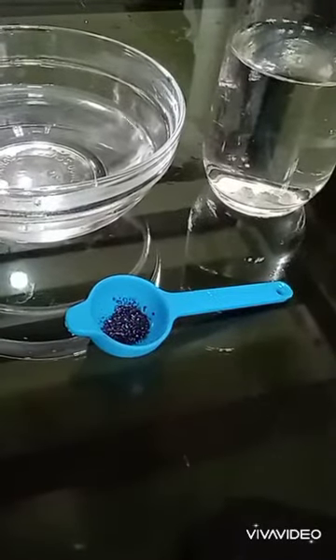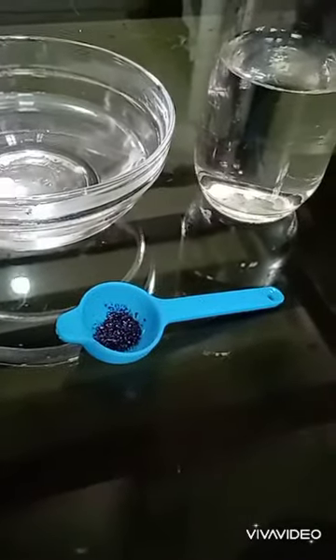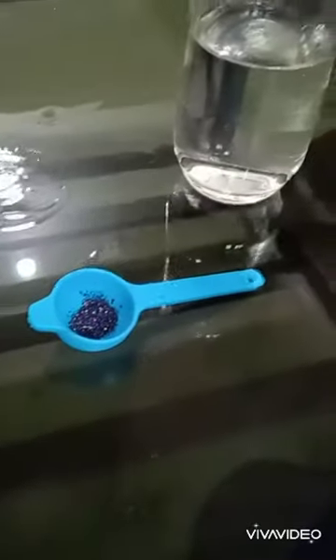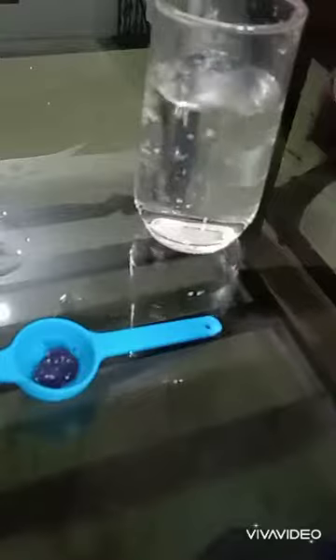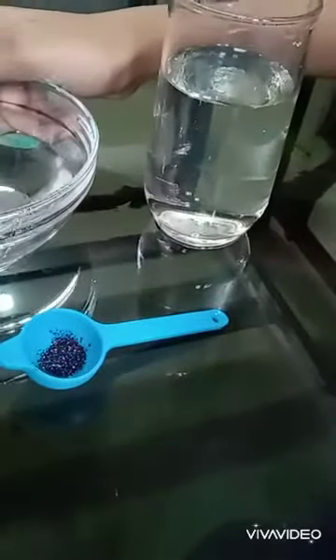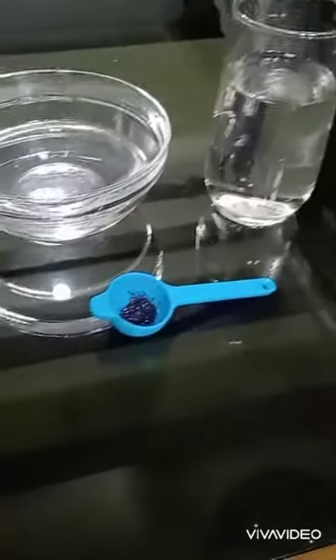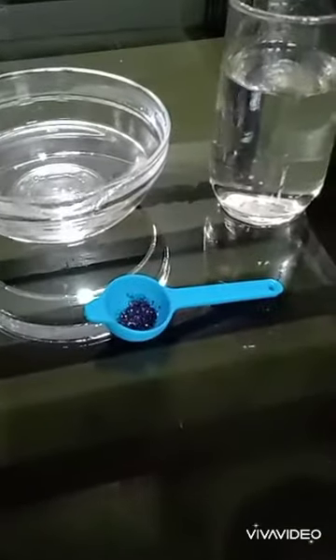Fill the glass with half of water and put a crystal of potassium permanganate into it.